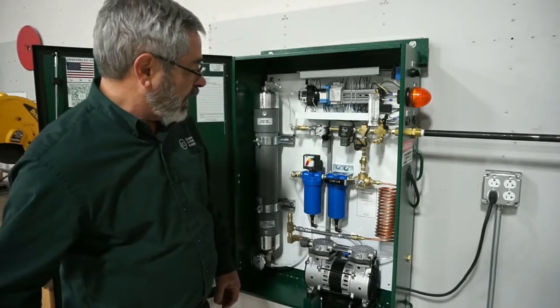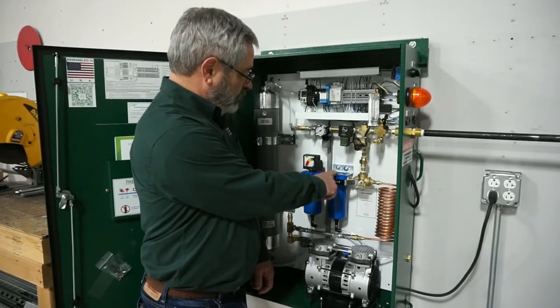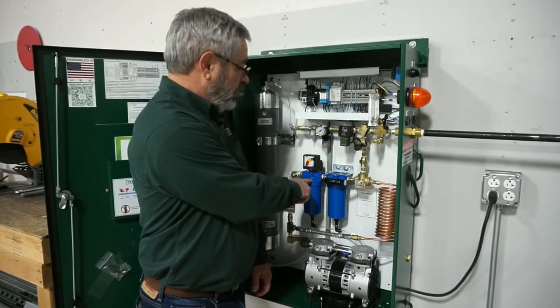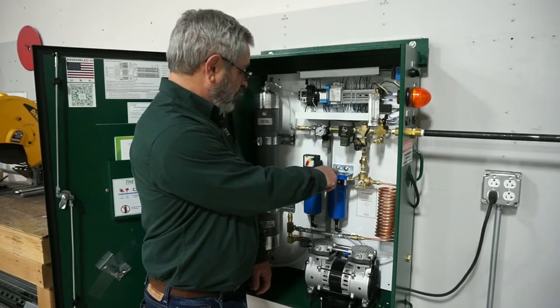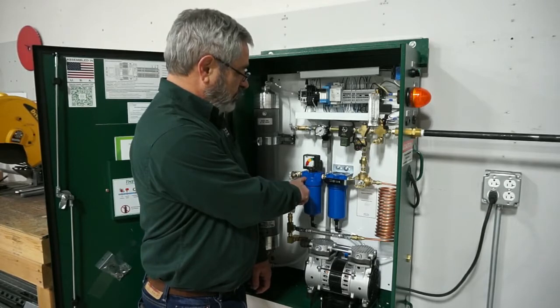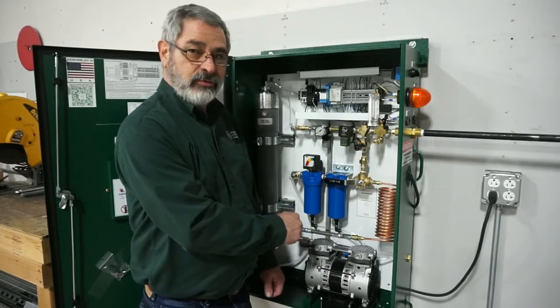There's a tip I like to do: the water separating filter is the first one, and the coalescing filter is the second one. What I like to do is take a Sharpie and mark on the top of this filter 'water separation' and on this filter 'coalescing,' which is a number six filter. That way I don't have to remember it next year when it's time to do another filter replacement.